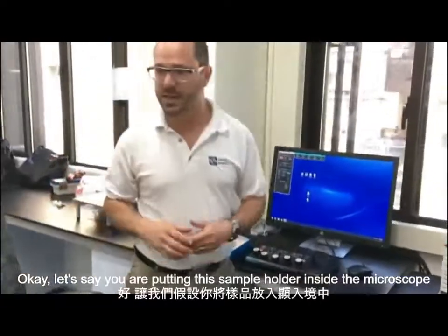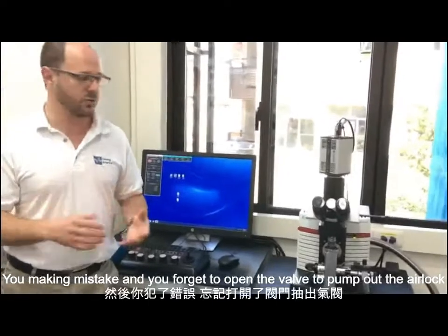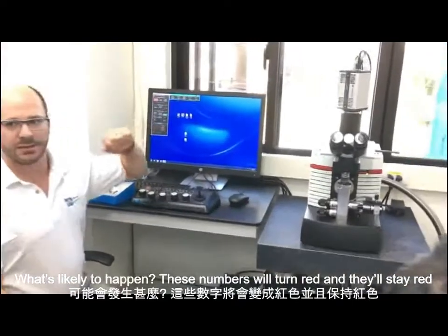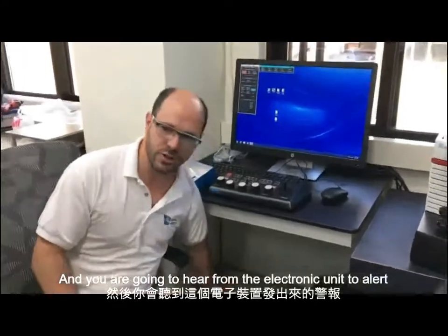Okay, let's say you're putting the sample holder inside the microscope, you make a mistake and you forget to open the valve to pump out the airlock. What's likely to happen is these numbers will turn red and they'll stay red. It won't be for like 1 second. They'll stay in the red all the time. And you're going to hear an alarm from the electronics unit.